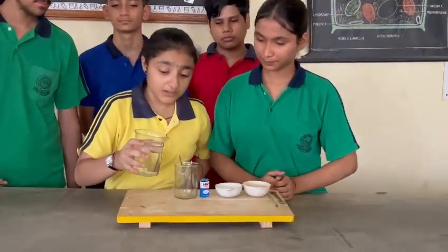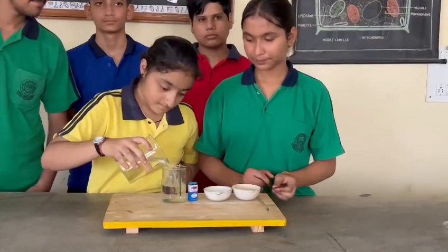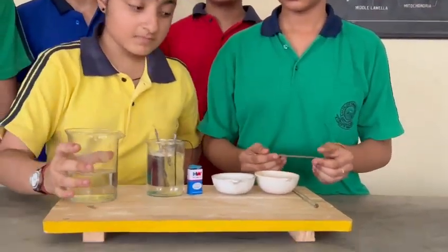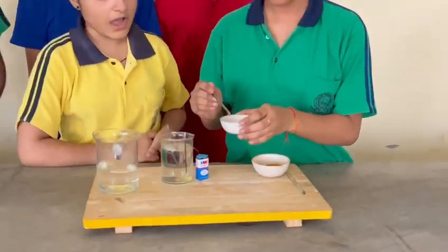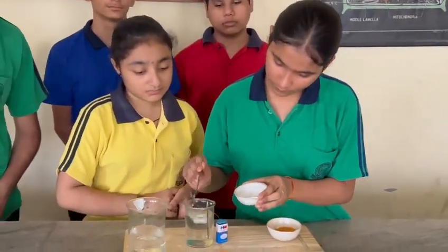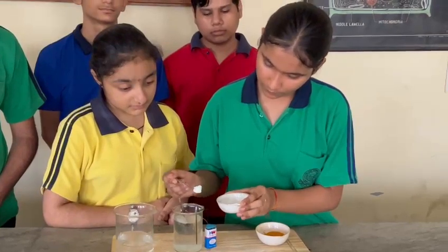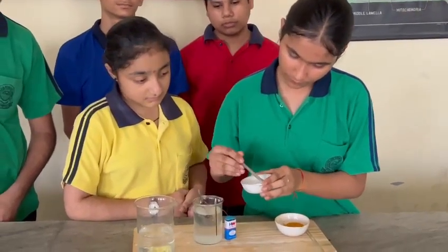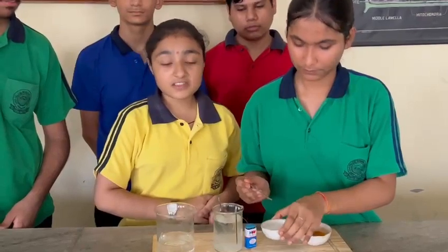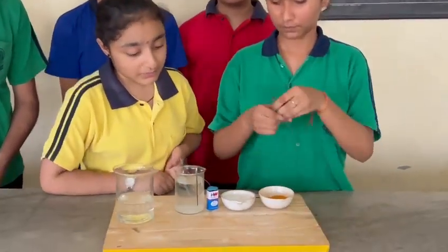First, we are going to pour some water in this beaker. Then we are going to add some common salt in the solution. After this, we have to dissolve the common salt in the solution completely.